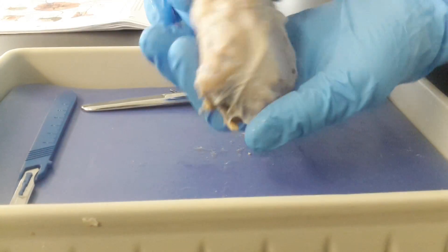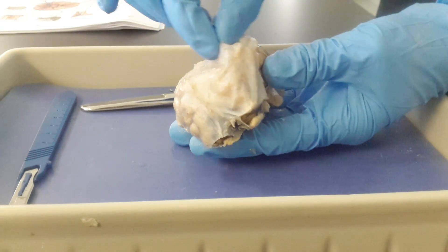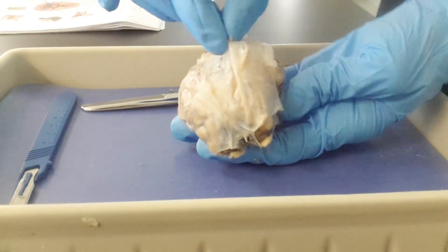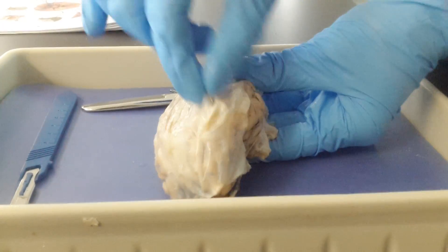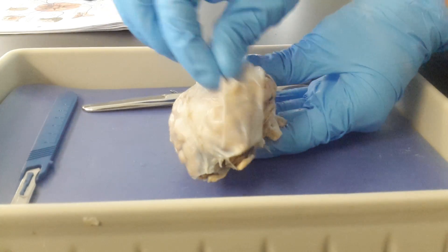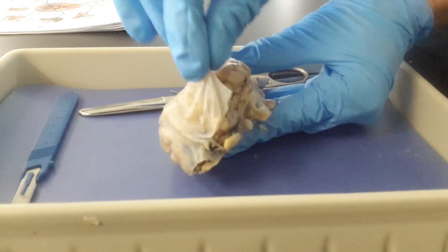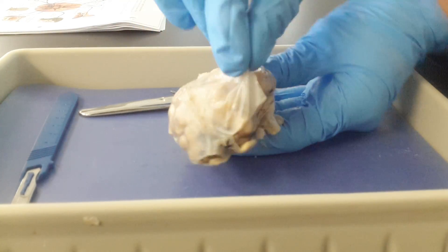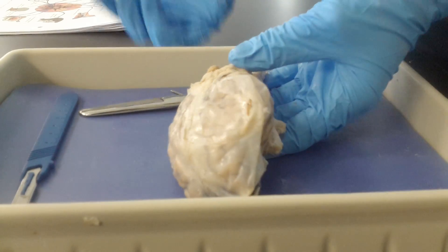First off, looking at the brain from the outside, we see that we have this thick, tough, connective tissue layer. These are the meninges. Specifically, this strong, tough outer layer is showing us the dura mater.